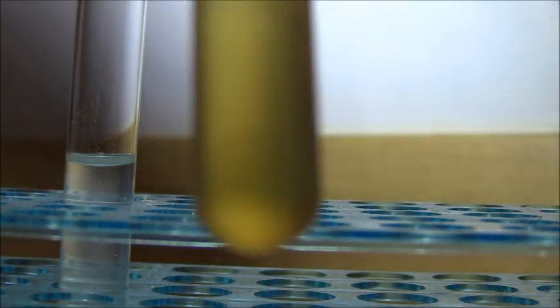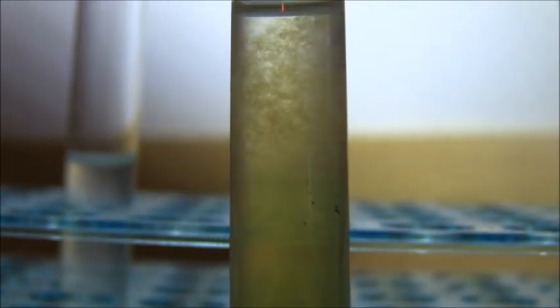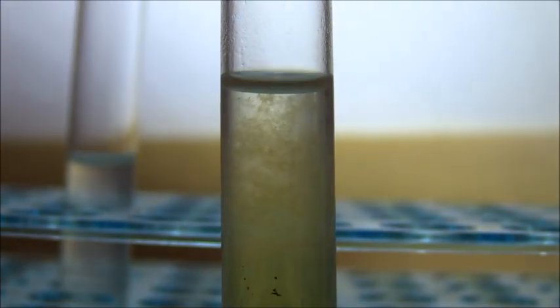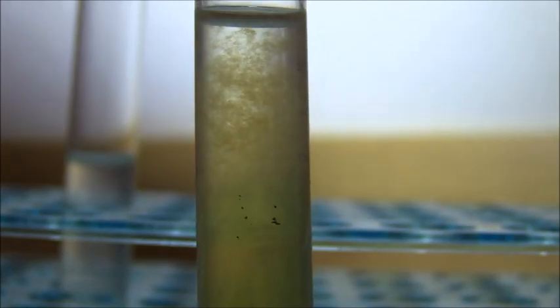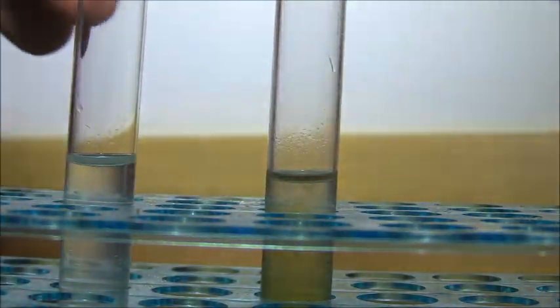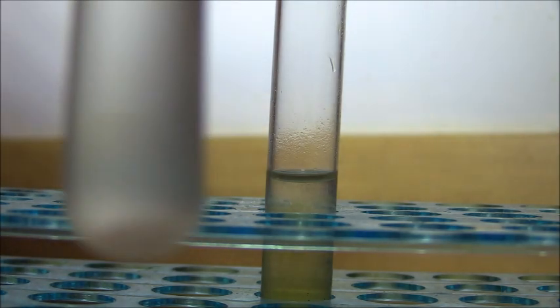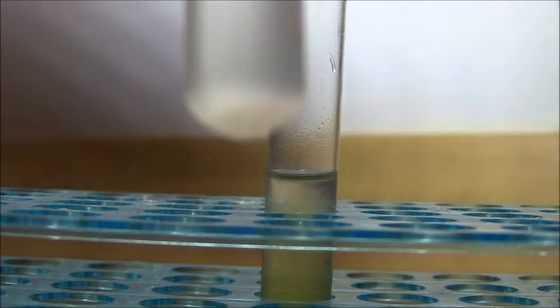Which is quite remarkable considering that formamide only has one carbon with an amine group, and purines are a big ring structure as you saw in the previous segment of the video. So you can see our nice brown precipitate, and the control, even though it has the same ingredients, doesn't have that. It just has the calcium carbonate at the bottom, which is the excess.